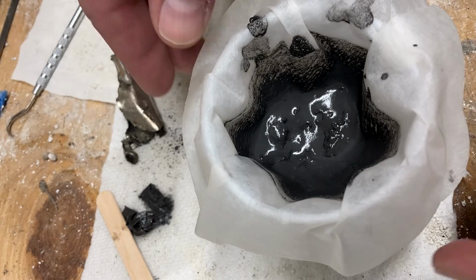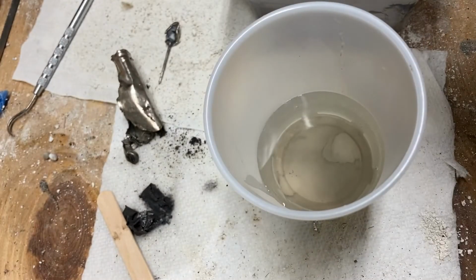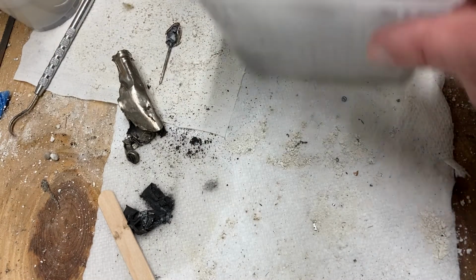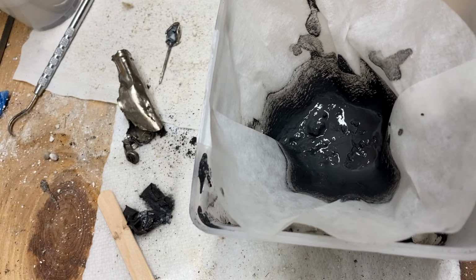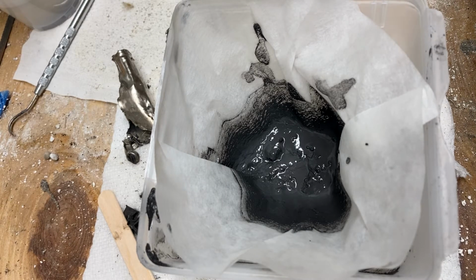All right, so now we got all of the solids separated out, for the large part. And since what I'm going to do is use some citric acid in this, I think I'm just going to leave it in the coffee filter because the citric acid isn't going to do anything to that anyways. Then I'm going to add a little bit of water in there and let it go that way. Seems to me there's no really good reason to lose material by trying to scrape it all off of the paper, since I'm going to try to solubilize the stuff I want.